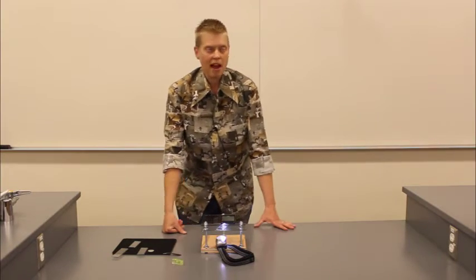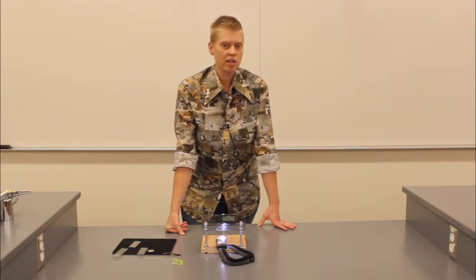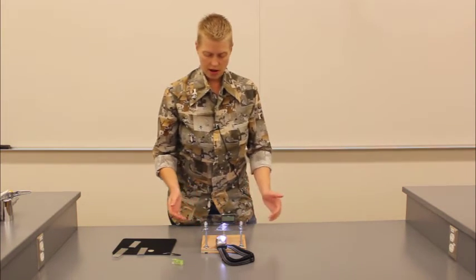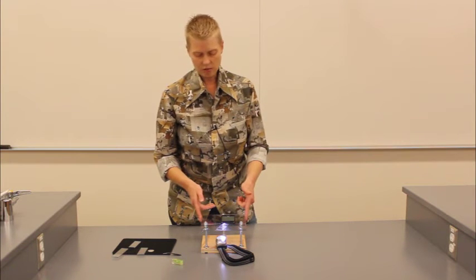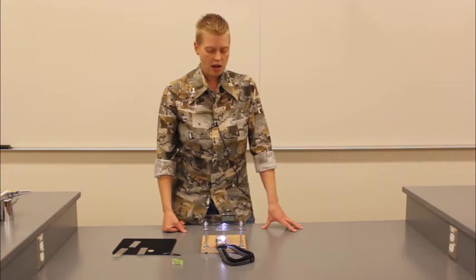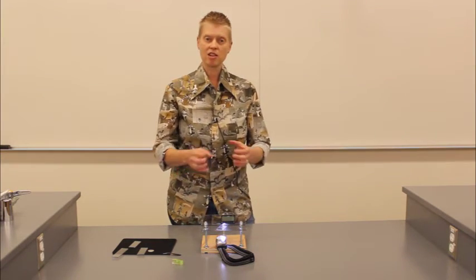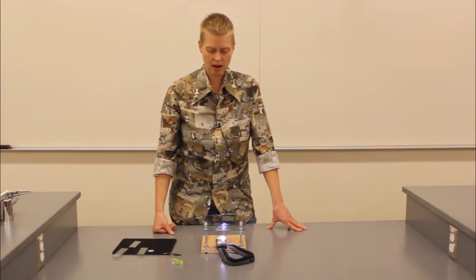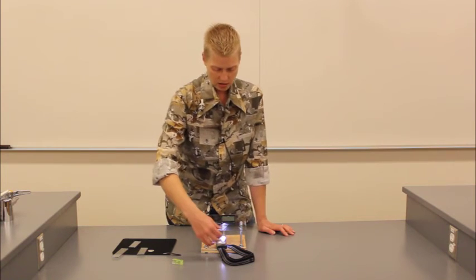If you want to get more magnification with your microscope, you can also use 2 of those focusing lenses, and that will increase the magnification of the microscope that you can look at your specimens with. This plexiglass is a little bit too thin to put 2 lenses in. I haven't tried it using a separate piece of plexiglass underneath there with a second lens, but that's a possibility too if you can't find a second piece of plexiglass that's thicker. So that's the Elodea leaf.